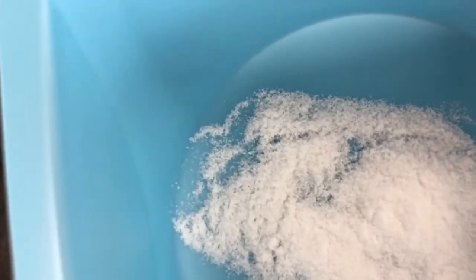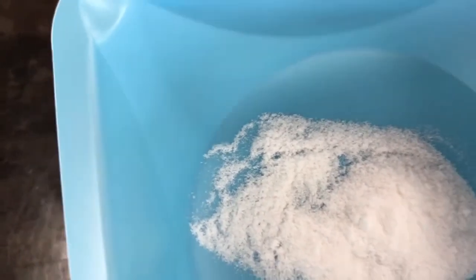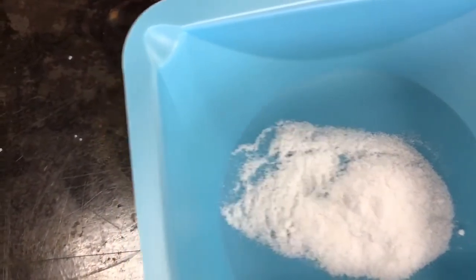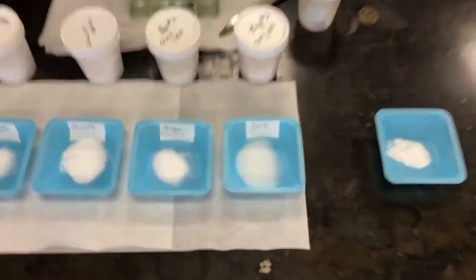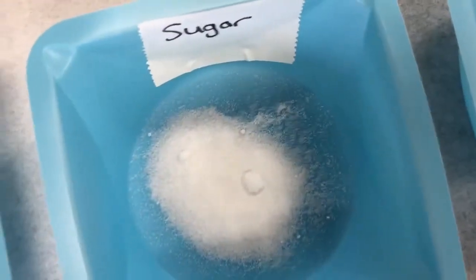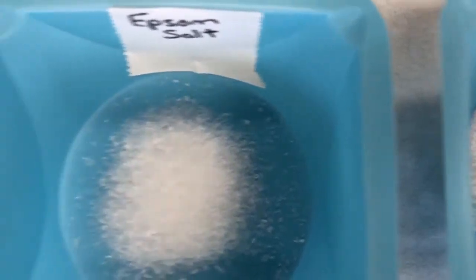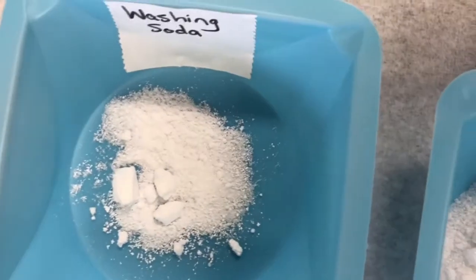Okay, so we do know based on our results that there was only one substance that was white and powdery, but again, they all did look very similar. So even though we can maybe guess what it might be based on its physical appearance, because they all look so similar, it's probably not good to rely on that as a method for identification. So we're going to do the other tests as well that we did with the other solutions.